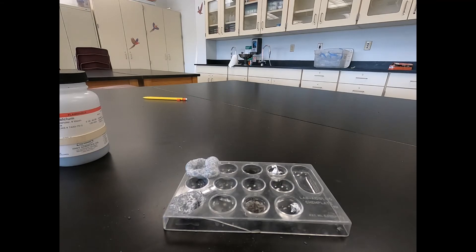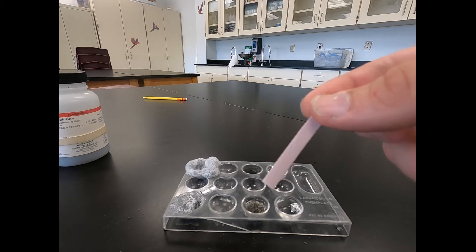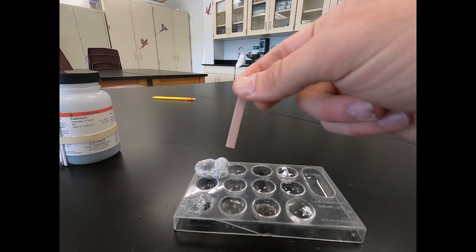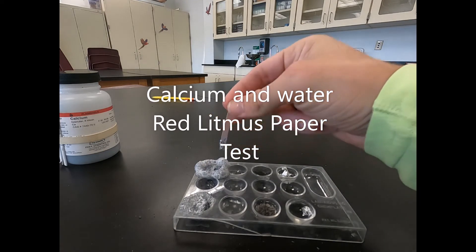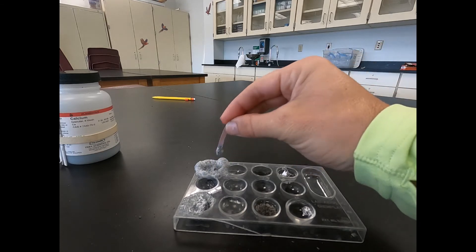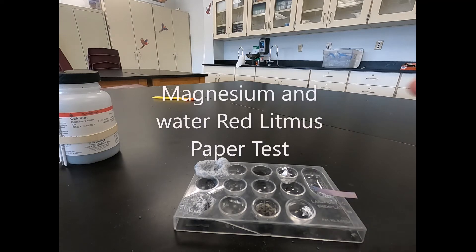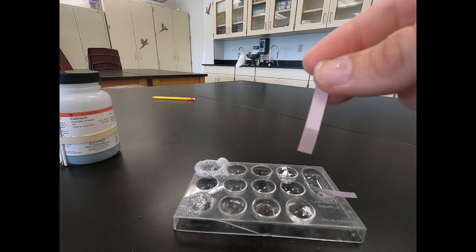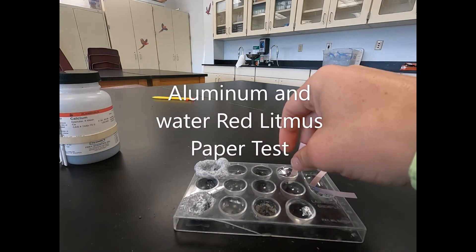Now that we've done our reactions, we're going to use some red litmus paper to see whether we have acids or bases. With this red litmus paper, we just dip it in. If it remains a red color, we're looking at an acid. If it changes to a blue color, we're looking at a base. So we'll start with our water and calcium. You can see a clear change to blue — you can see that clear change to a blue color. Then we'll do our magnesium with distilled water. And finally, our aluminum with distilled water.